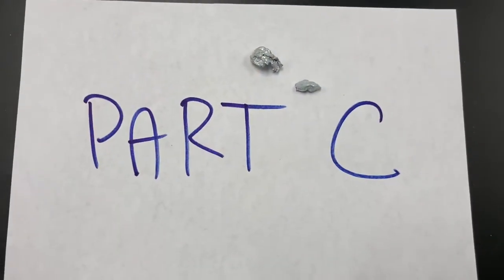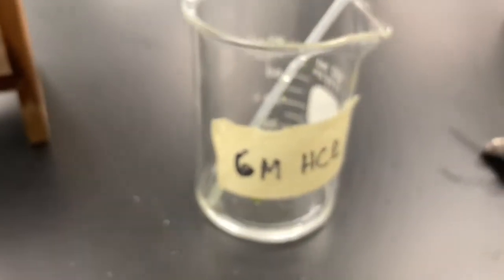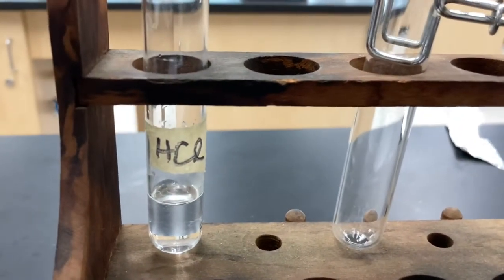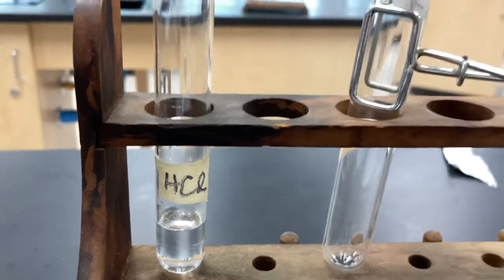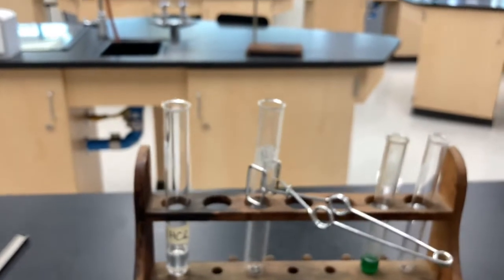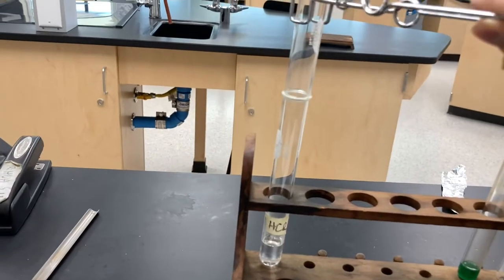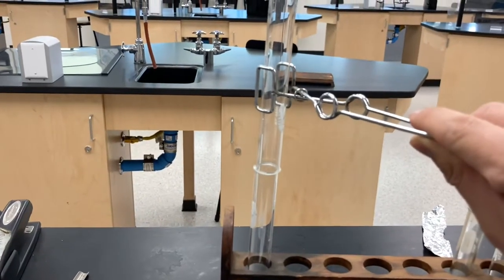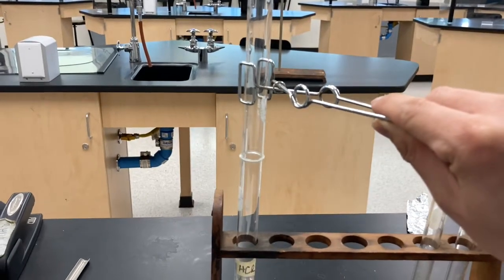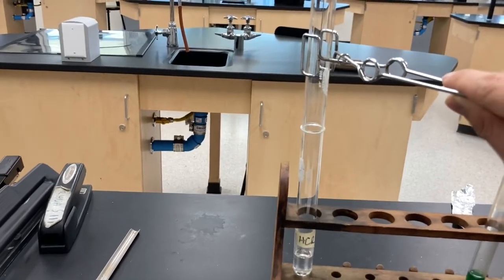All right, in part C here, we are going to take some zinc, so get a good look at the zinc, and we are gonna combine it with that same acid, that 6 molar hydrochloric acid. Again, this is some really strong acid here, so I've got some of that acid in a test tube already. In a moment, I'm gonna add the zinc to that test tube, and then using this other test tube you see here, I am going to collect hydrogen gas. I'm gonna do that by inverting this test tube on top of it and collecting gas in the upper test tube. Then we're gonna check to see if there is indeed hydrogen gas by igniting that hydrogen gas over a Bunsen burner.